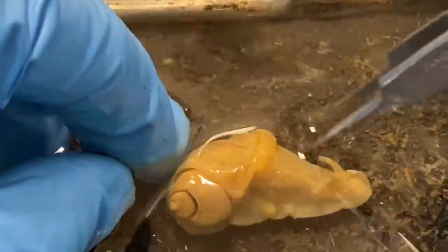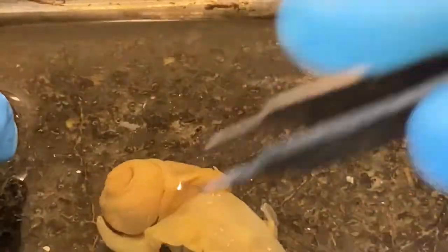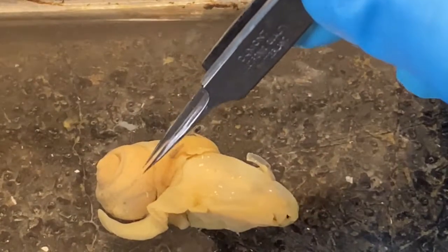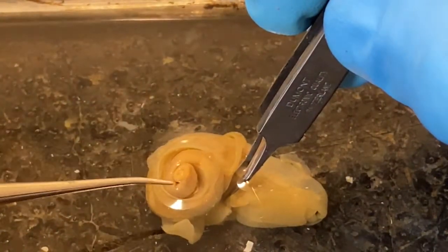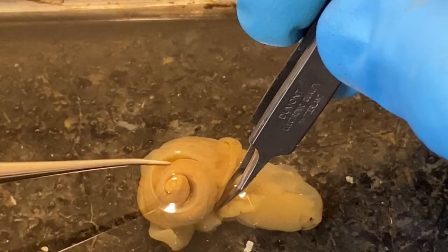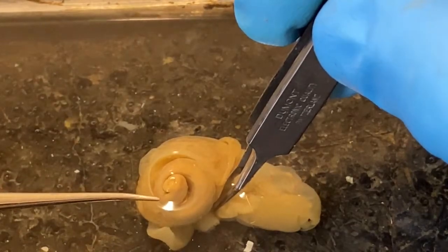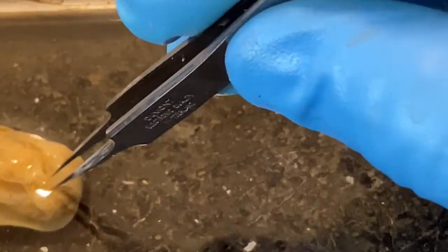Looking at some other anatomical structures: this is the posterior end of the foot back here. At the very top of the coil, we have ovotestis up in here. Then just posterior or below that, we have digestive gland. And if we rotate this around, the material in the back includes oviduct and other material.